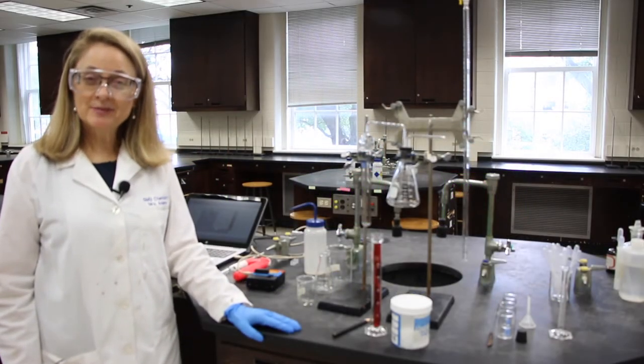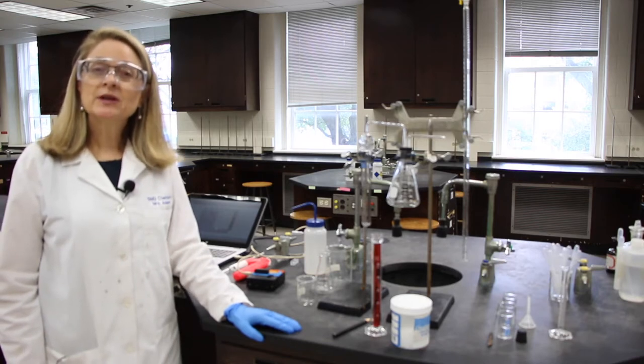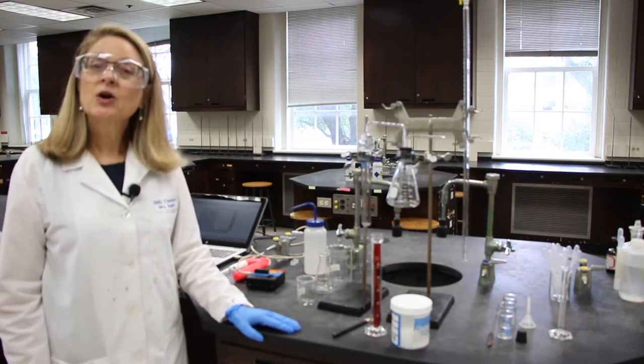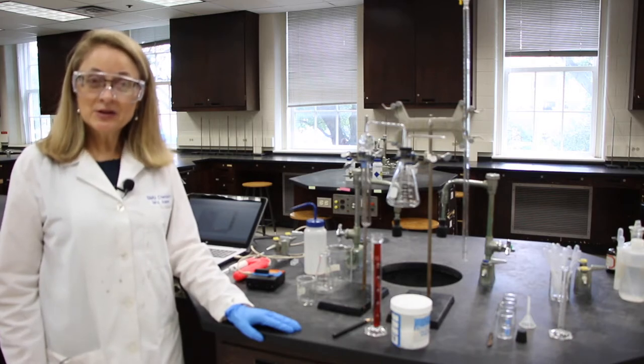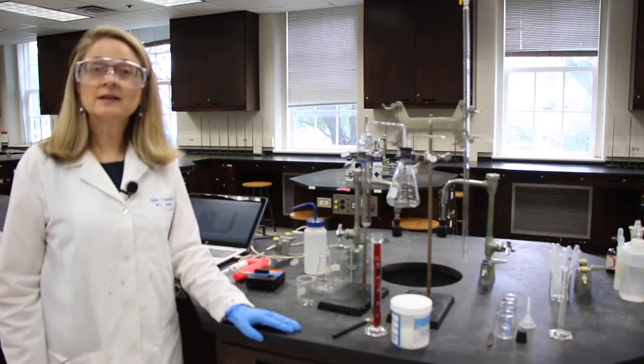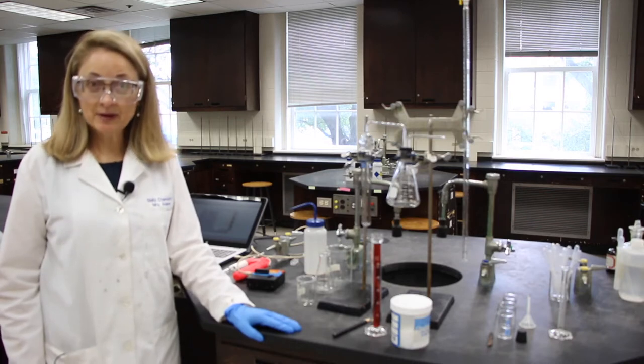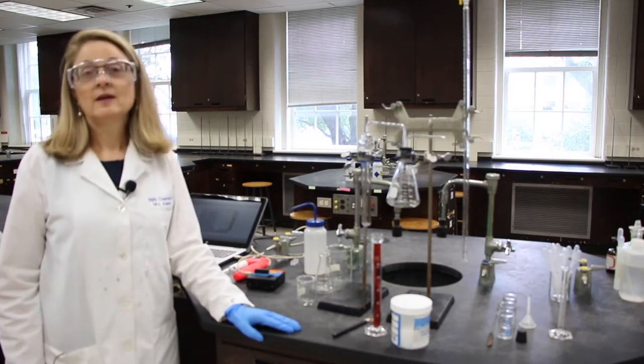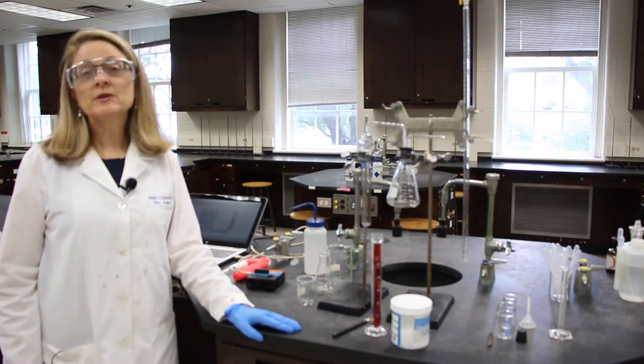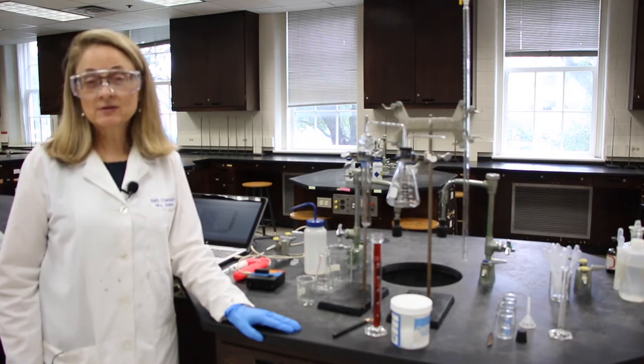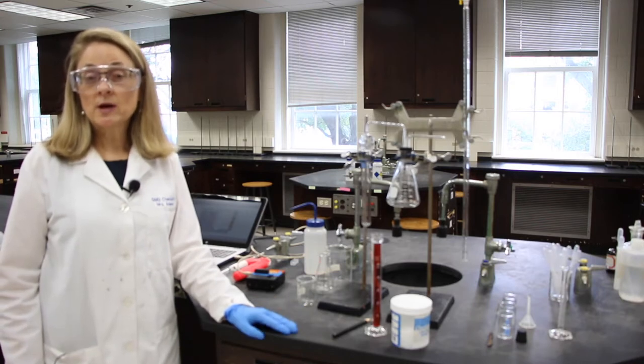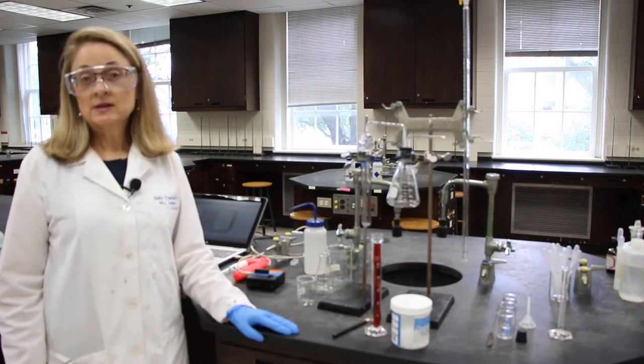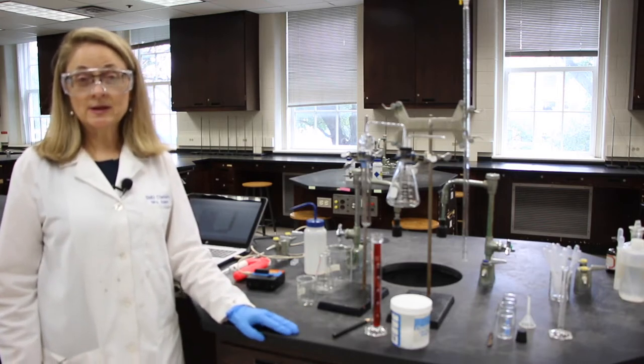Hello and welcome to lab. Today we'll be doing Experiment 13, Quantitative Analysis of an Alloy. I'd like you to be my lab partner and follow along in your lab manual. Today we're going to determine the percent copper and the percent silver in the metal alloy. These percents may or may not add up to 100. There may be some other constituents in the alloy sample.